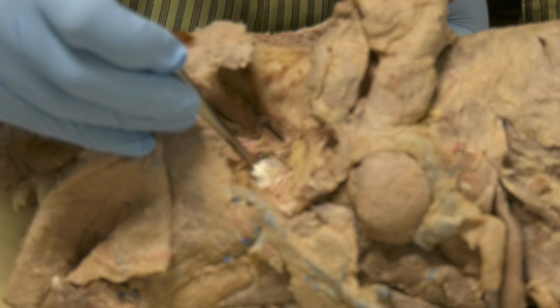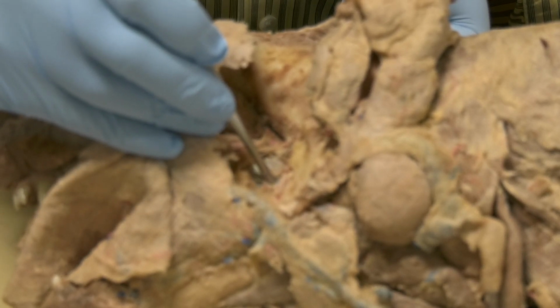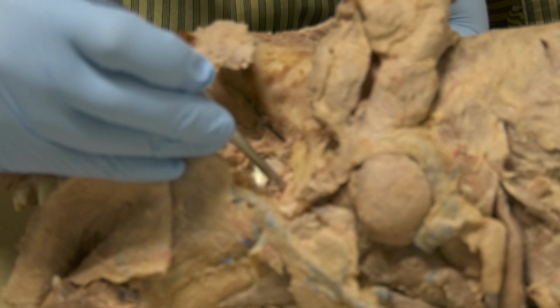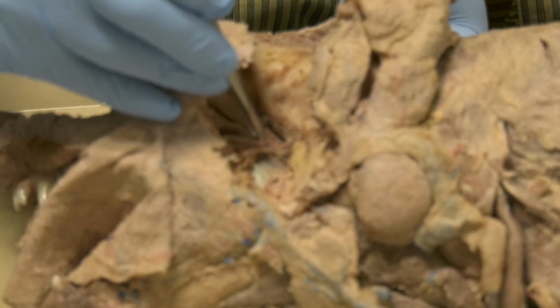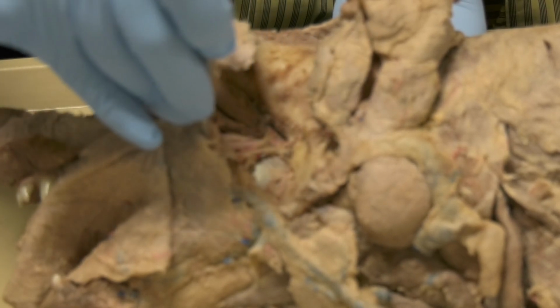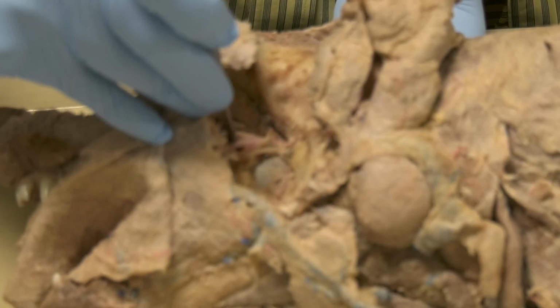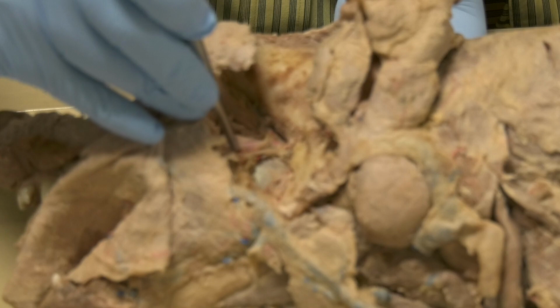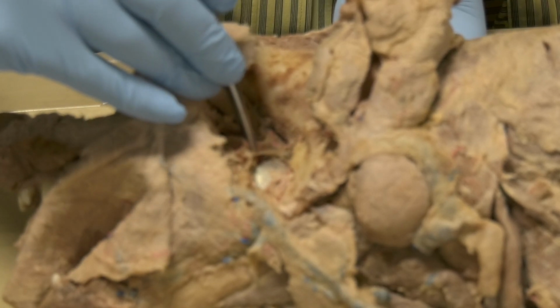And the most craniodorsal one, this is the lingual that goes to the tongue. So we have lingual, we have inferior alveolar, and we have mylohyoid, and over here we have the buccal branch. This one here that is going through the maxillary foramen, this is the maxillary artery, and this is the maxillary nerve. Okay, the artery that runs with the buccal nerve here, this is the buccal artery as well.